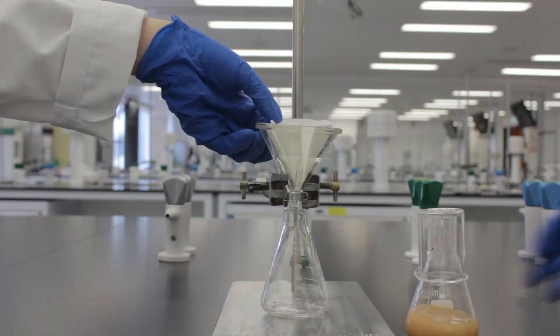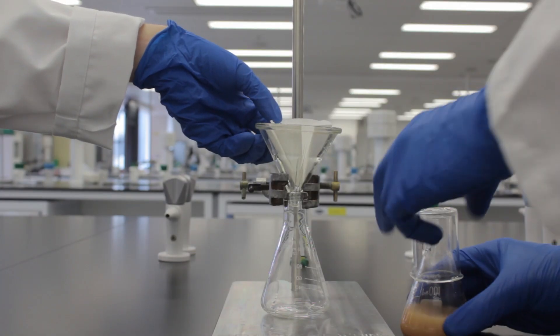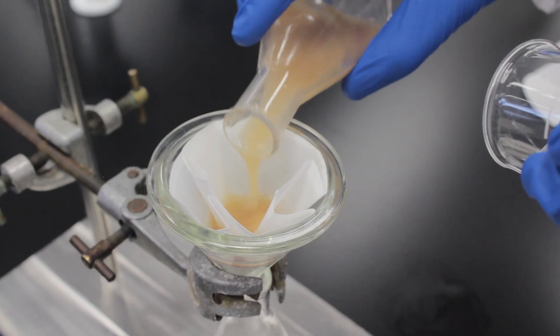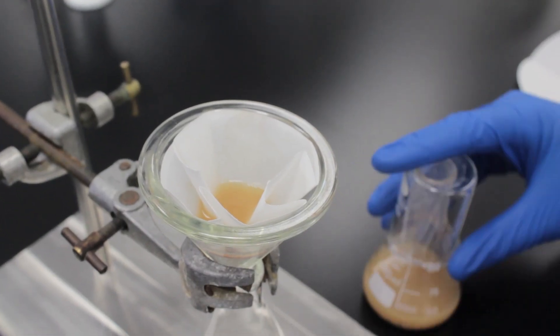Get an extra hand to hold down the filter and then pour the mixture through the funnel in small batches. Be careful not to overload the filter and make sure you put the beaker back on the flask to stop the ether fumes.